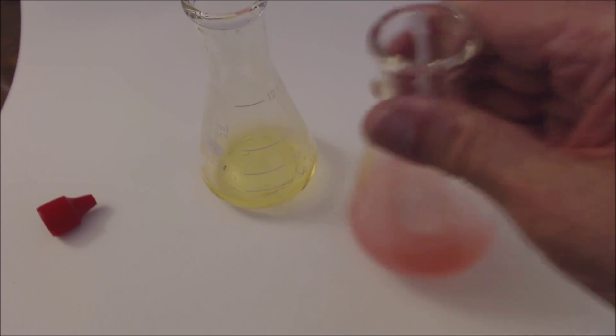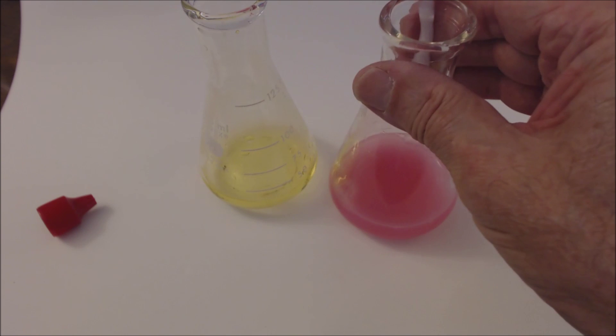As I swirl it, as more of the magnesium hydroxide dissolves, it gets more pink color.